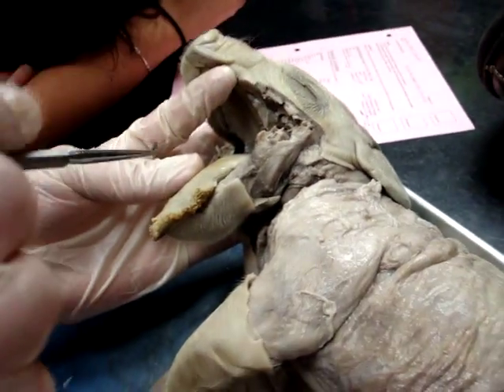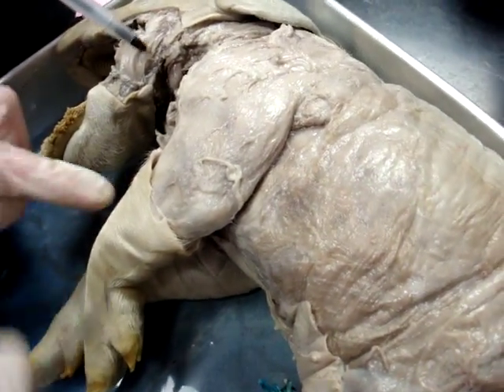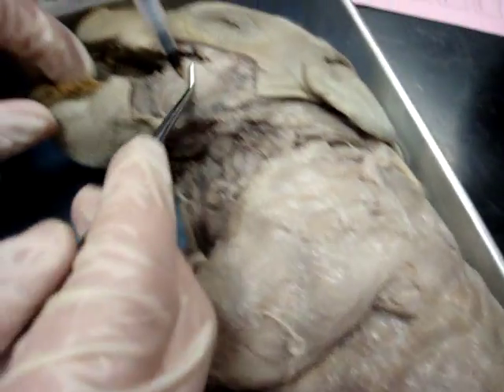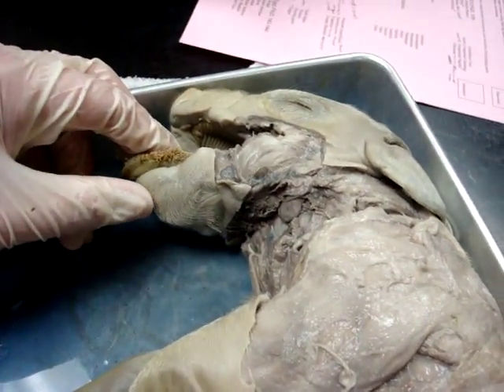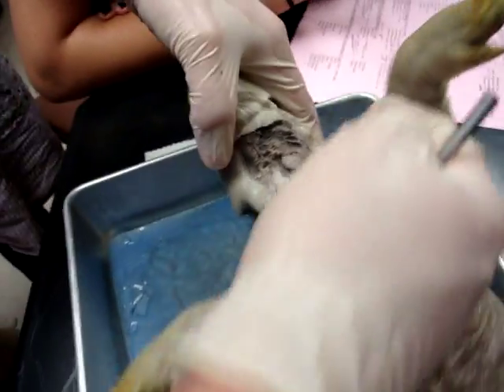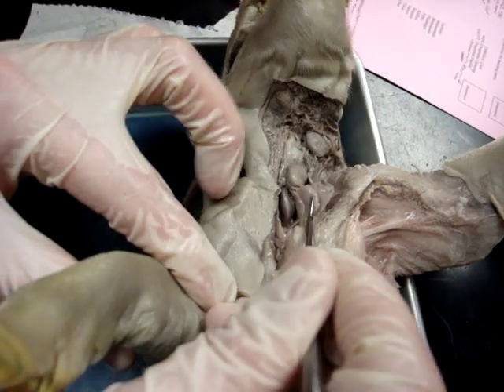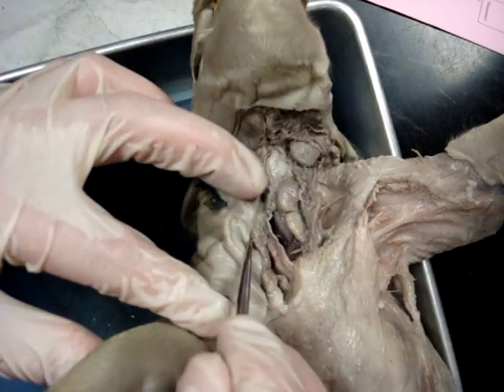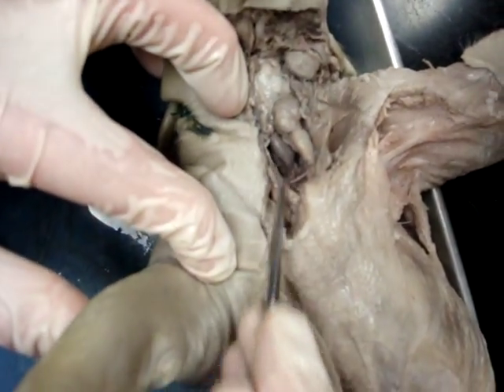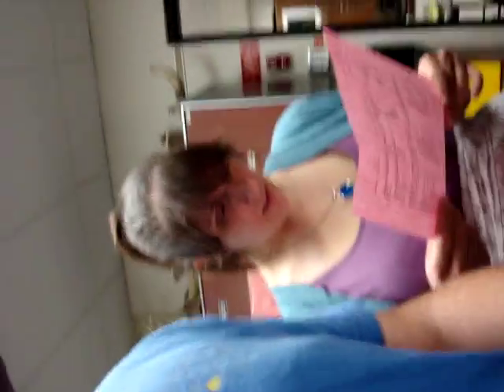Show me your parotid gland. Look at this guy — is that this sucker? The fat child? That's your parotid — it kind of goes like this. Exactly. Where's your masseter? The cheek muscle. There you go — big muscle. Let's go to where you've opened her up, down the chest. Where are your thymus glands? Those are all your lobes on either side. Show me your thyroid. Open it up so I can see where it's situated. Good — yep, that's your thyroid. Good job, Chase.